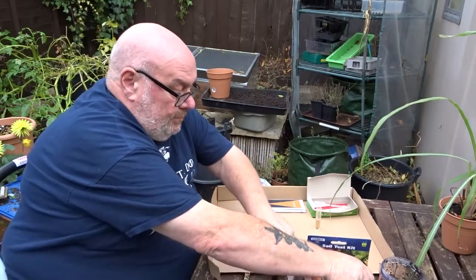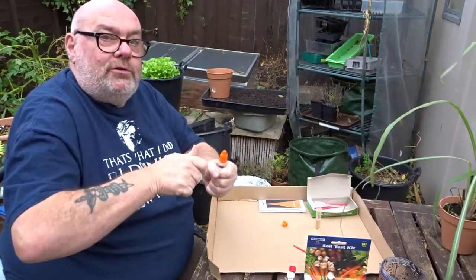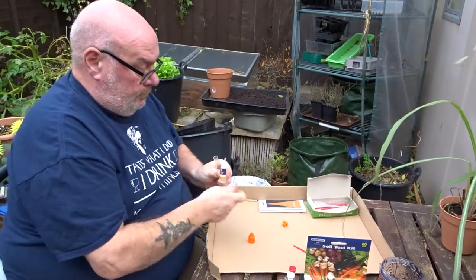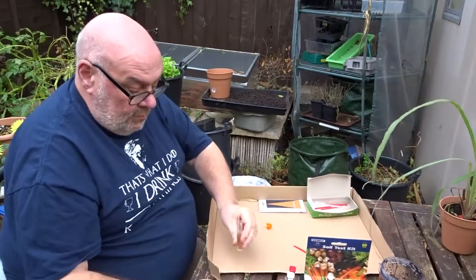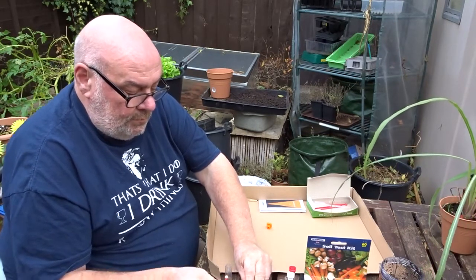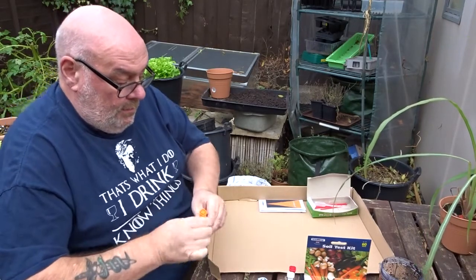And last but not least, potassium. Child-proof top — there we go. Half a ml. Heap scoop, and a potassium reagent powder. Leave it five minutes.